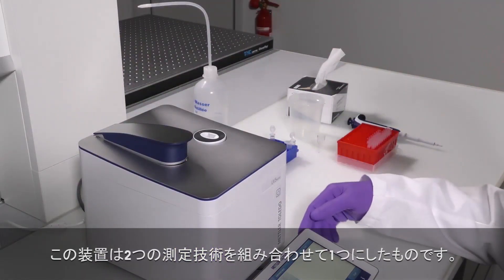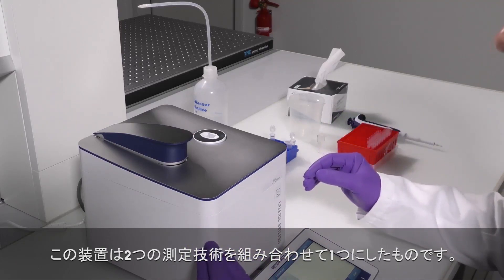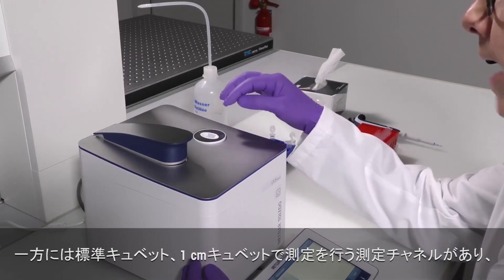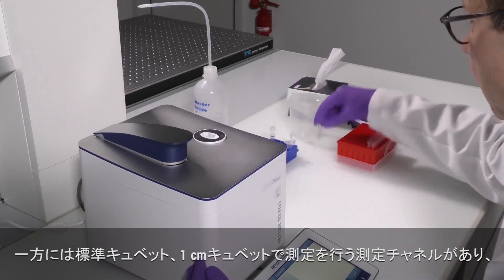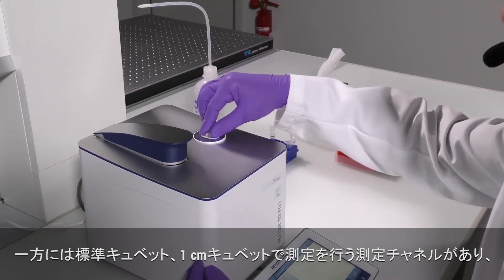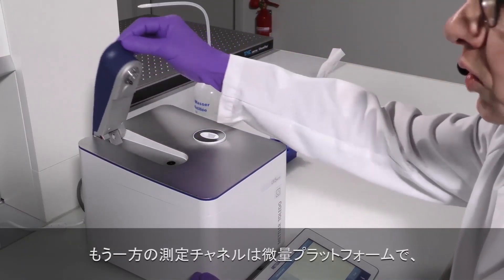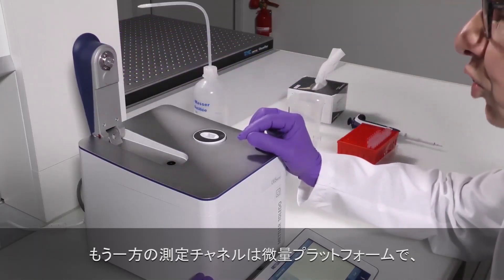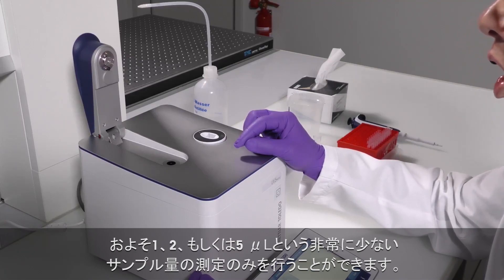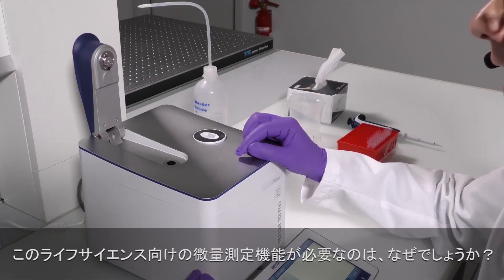The UV-5 nanospectrophotometer actually combines two instruments in one. You see here that we have on one side a measuring channel to perform measurements with standard 1 cm cuvettes, and the second measuring channel, a so-called microvolume platform, which allows measurements with very small sample quantities of approximately 1 to 5 microliters only.